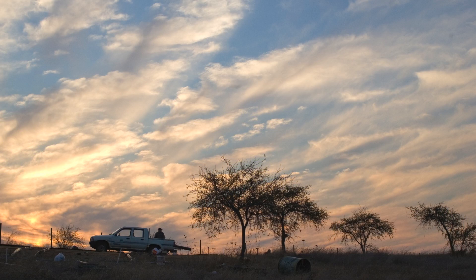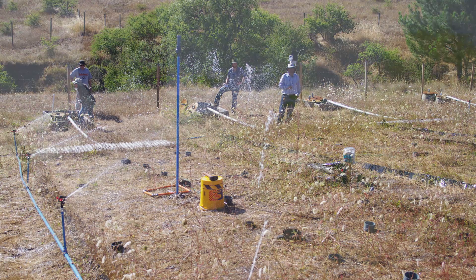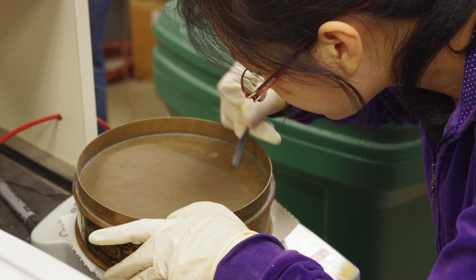These laboratory experiments are really to help us understand what we see when we go out to the field — how water is moving through, interacting with, and being stored in these vertisols. We find these soils a lot of times in productive agricultural regions. As we look to expand agricultural operations and try to feed a planet of up to 9 billion people on limited water resources, it's really important to understand these processes so we can make effective use of our land and water resources.